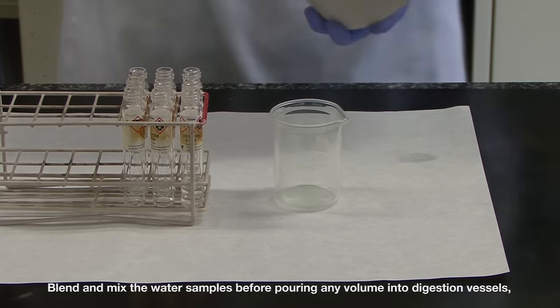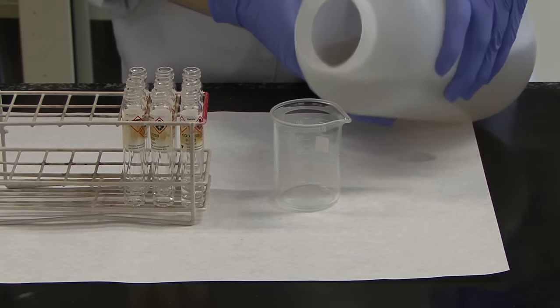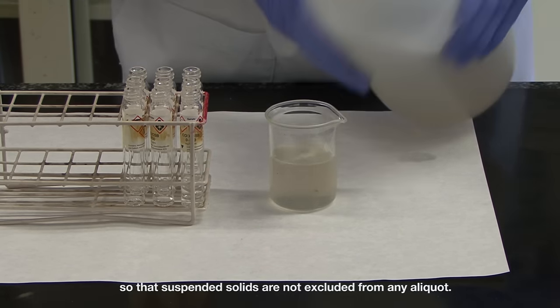Blend and mix the water samples before pouring any volume into digestion vessels, so that suspended solids are not excluded from any aliquot.